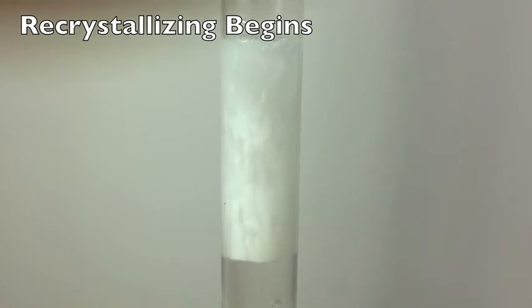So supersaturated solutions, we can get excess dissolved. It shouldn't be, but we can get it dissolved and it stays dissolved until we add a seed crystal like we did here. Here we go.